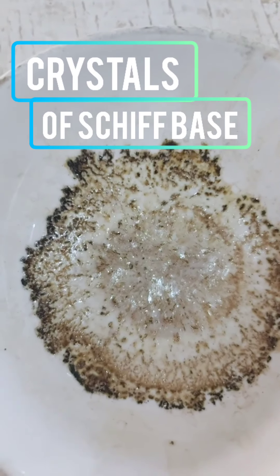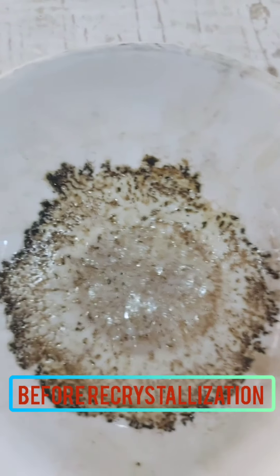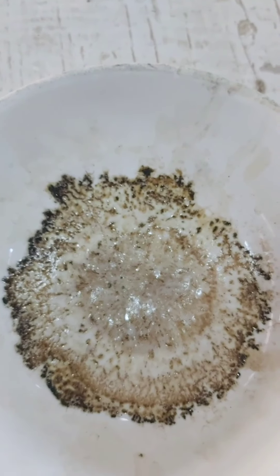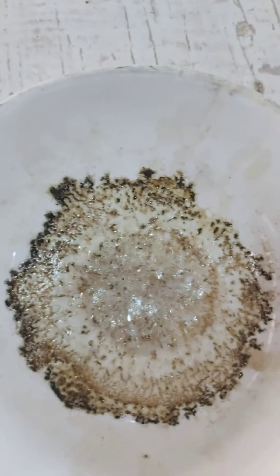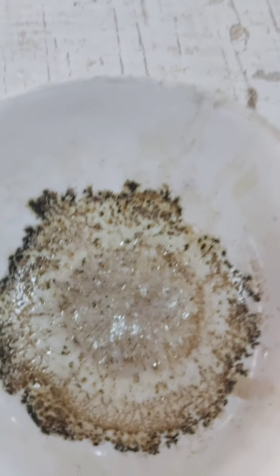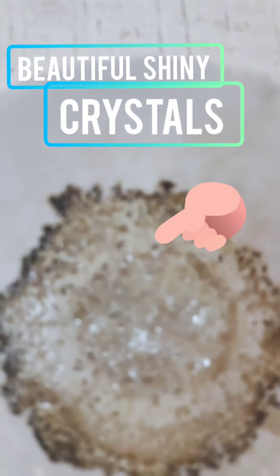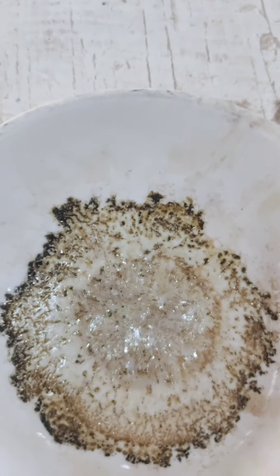The compound is benzylideneaniline. It is not yet in a purified form — they are going to recrystallize it to get colorless crystals. The melting point is supposed to be around 52 degrees centigrade. Simply beautiful how the crystals look.